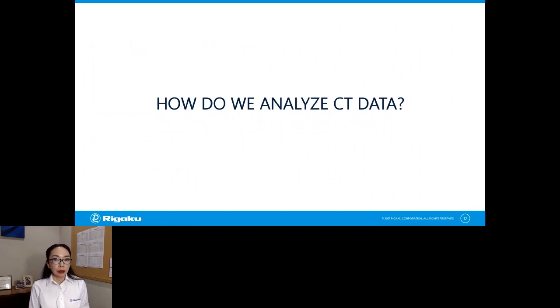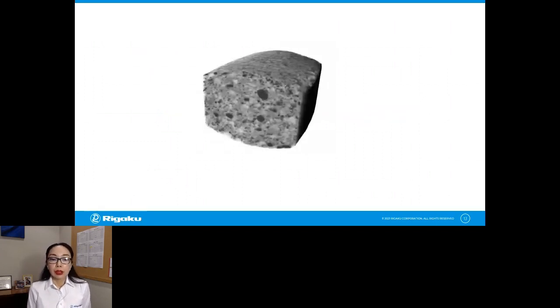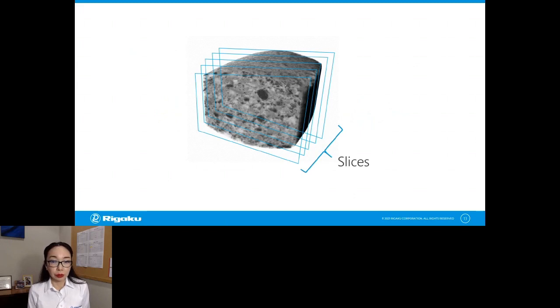How do we go about doing that? How do we analyze CT data? Well, when you have a CT scan, something like this is a 3D rendered view of a multivitamin tablet. You see different gray levels, and it looks like a 3D volume. But this is just a collection of 2D slices. And those slices are usually saved in TIFF format, so sometimes people call this a TIFF stack. But that's what a CT scan is. It's a collection of 2D slices.